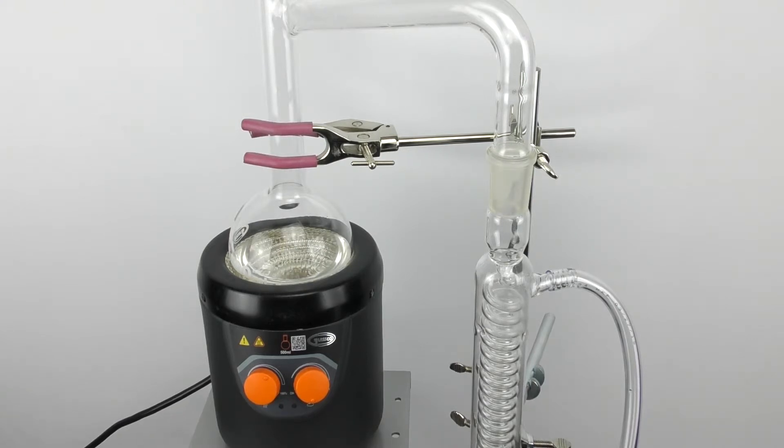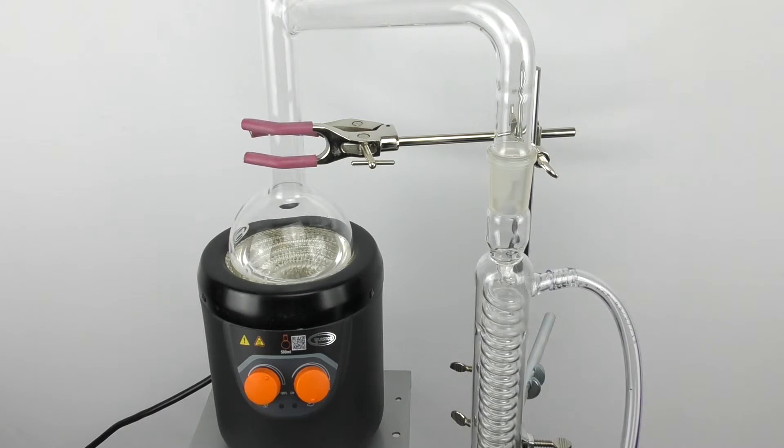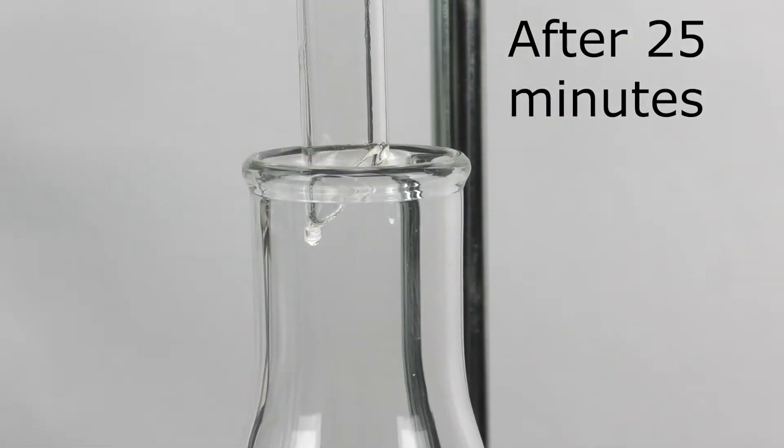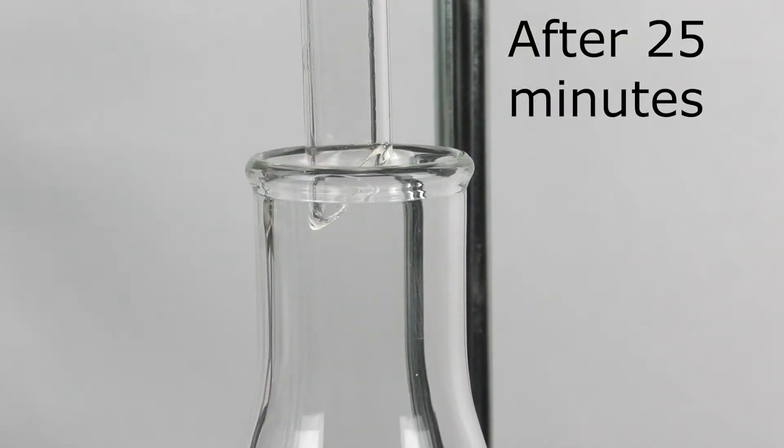But now this is going I'm going to turn on my cooling system. And here we have our first drip forming from our distillation experiment.